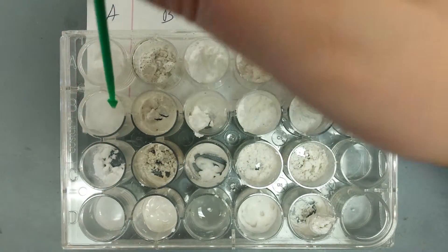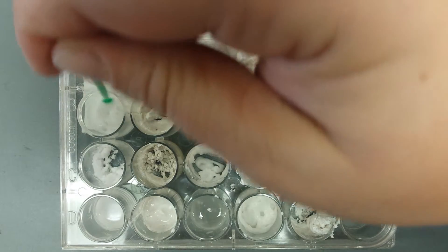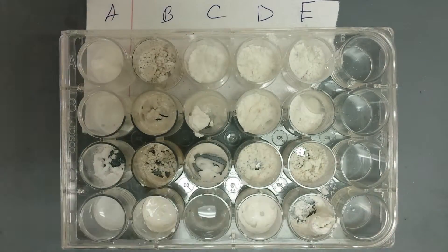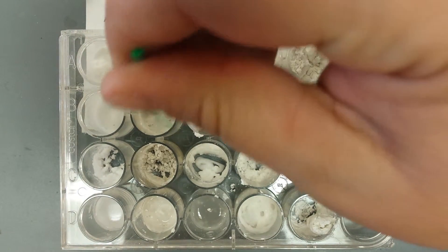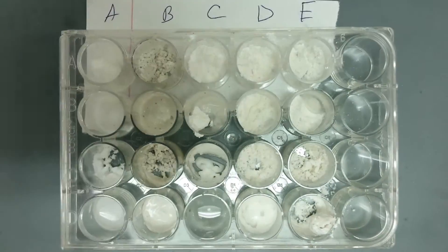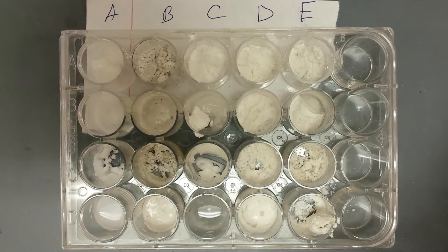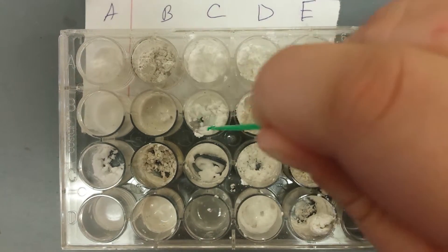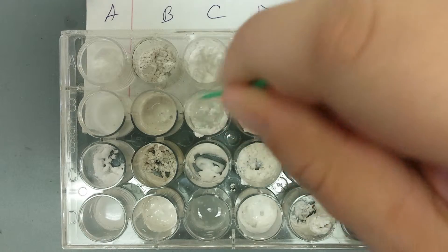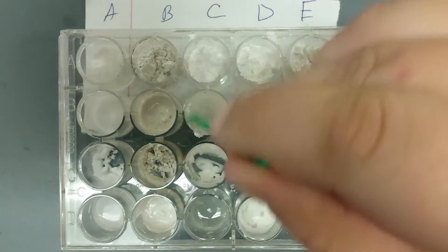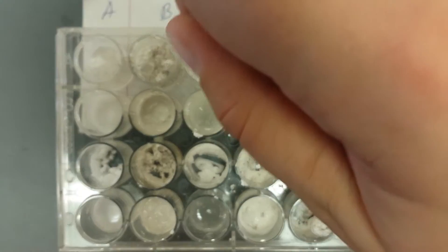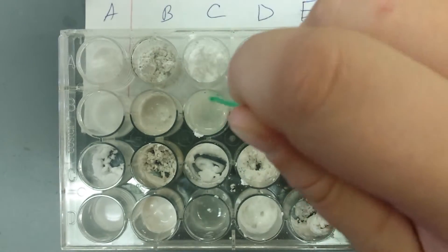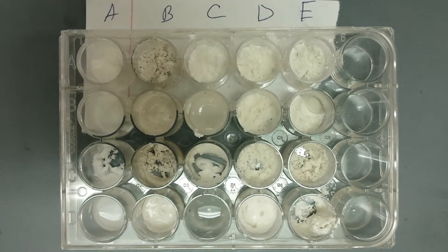Okay, mixing time. More fizzing. B is a little bit more fizzing. C. Did the bell already ring? That clock's just off, it's not working. Gosh darn, I didn't notice. I don't know what this powder is, but it likes dissolving stuff. So it dissolves? Well, like it kind of dissolved kind of like that first time. It was kind of weird.